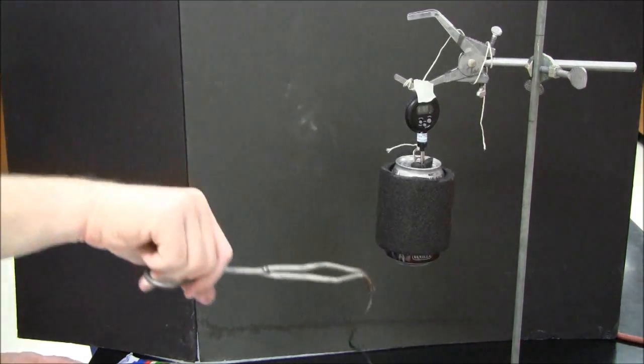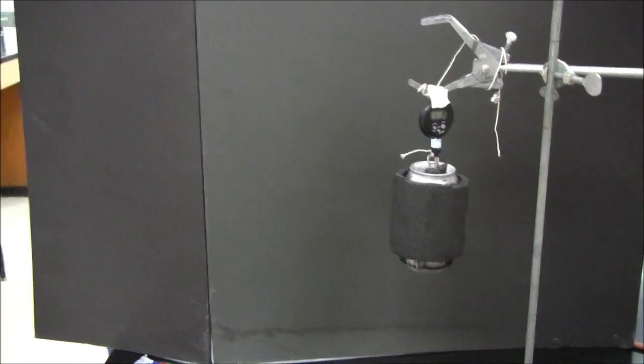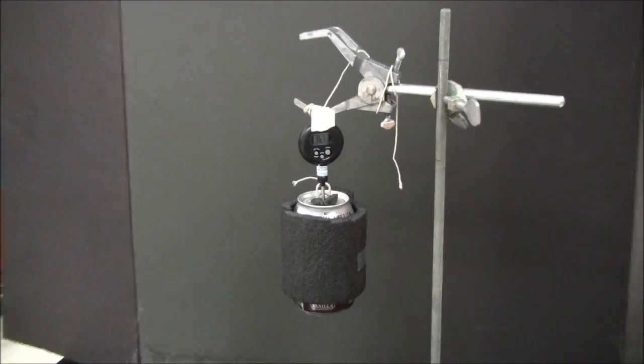Okay, pretty much done. Now let's look at the temperature. Now we need to take the maximum temperature. Wow, I can't believe it went up that high. Now the maximum temperature might not happen the second the experiment's finished. It might happen a little later. So that seems to have been the maximum temperature we had there. 36.7.